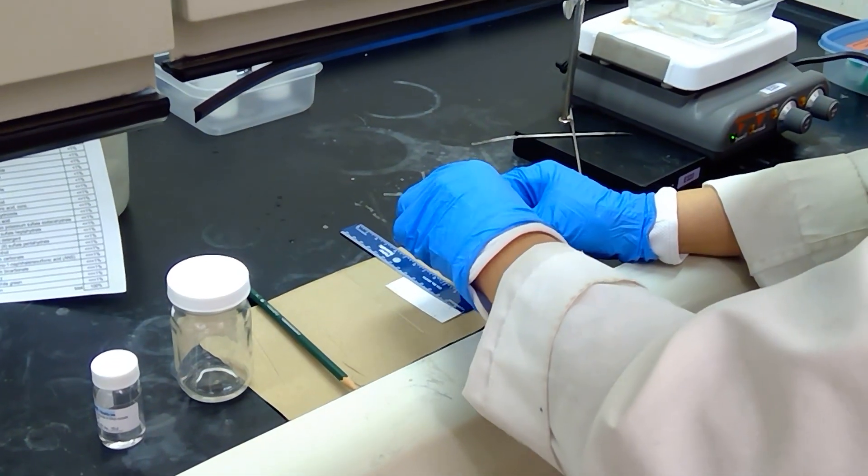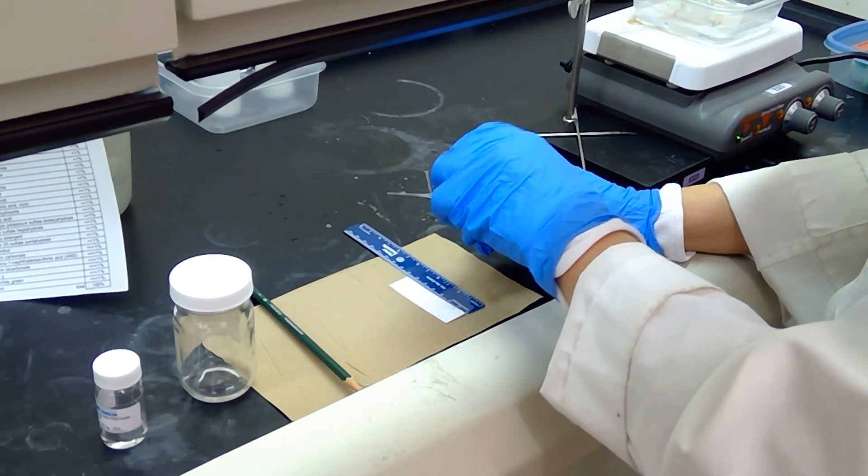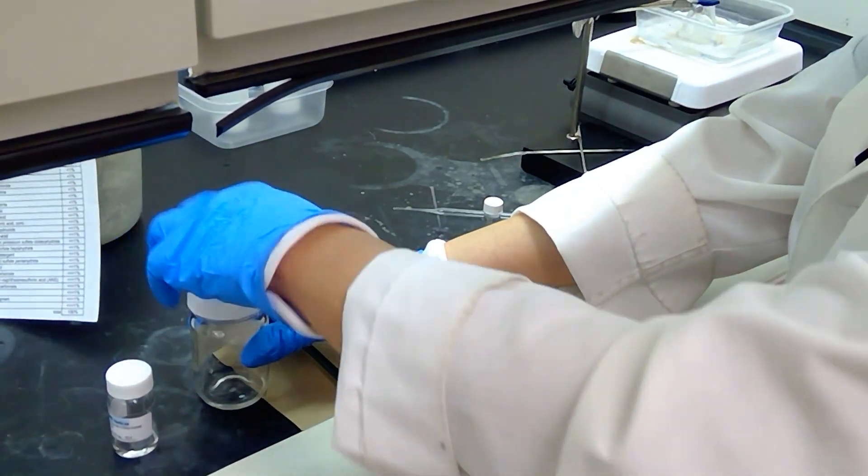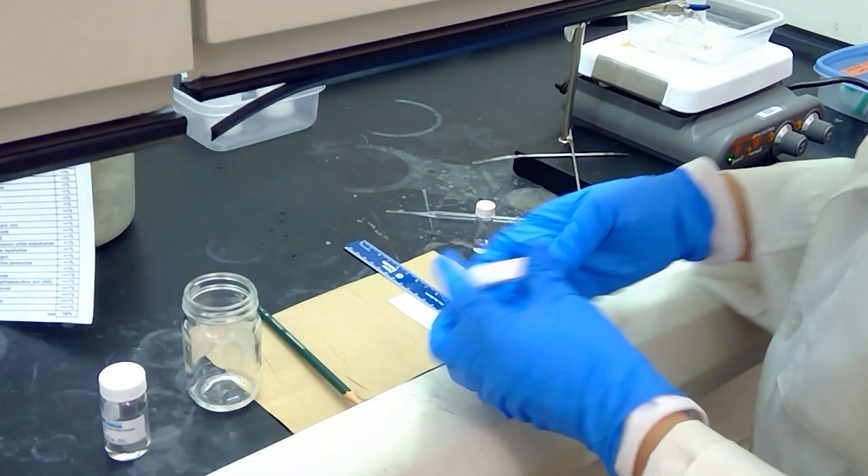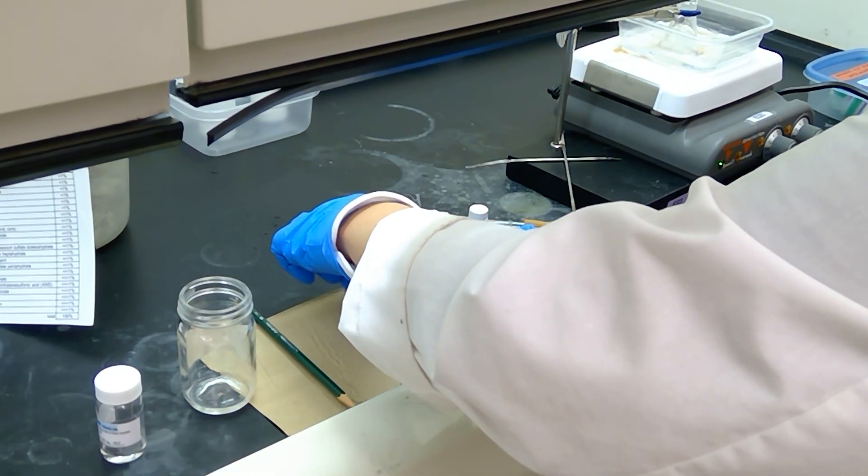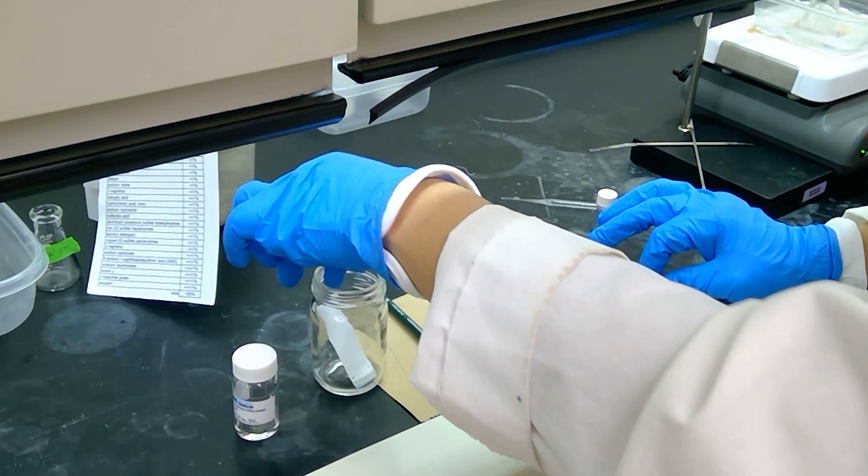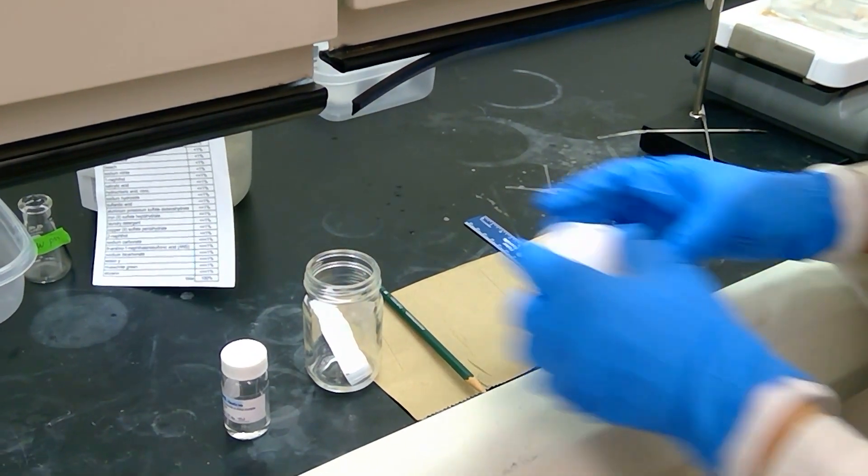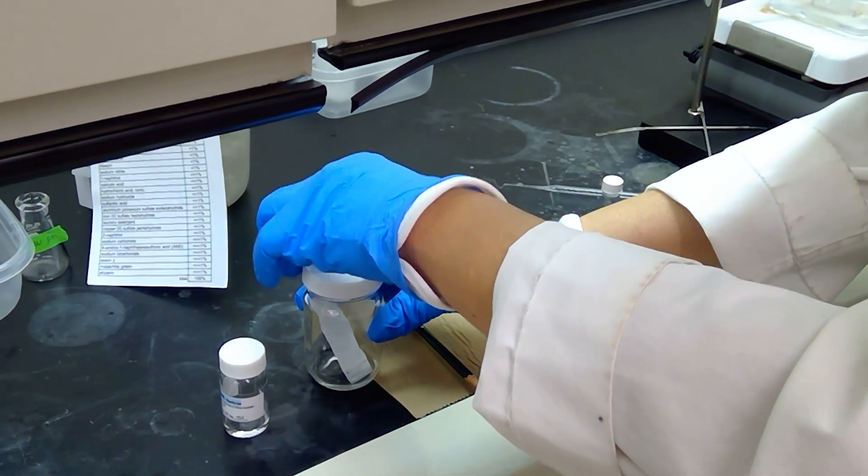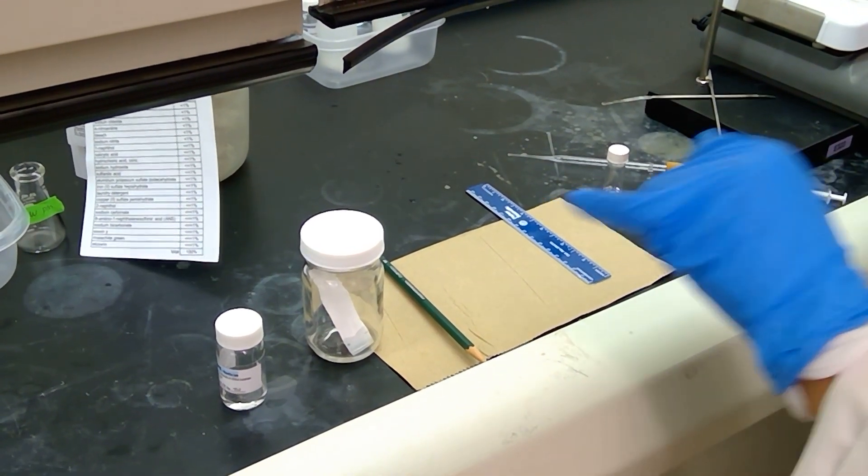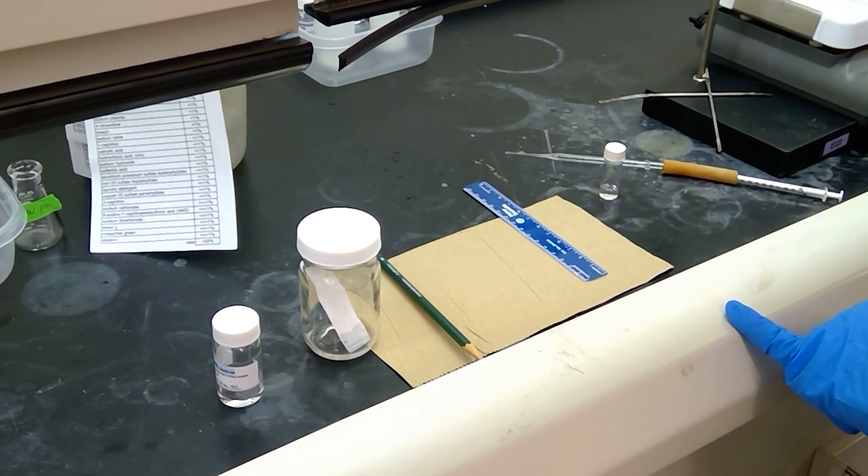I did two applications of our standard TLC solution and now I'm going to place our TLC plate into our developing jar. Once the liquid travels about a centimeter from the top, we'll be back and take a look under the UV lamp to see what we have.